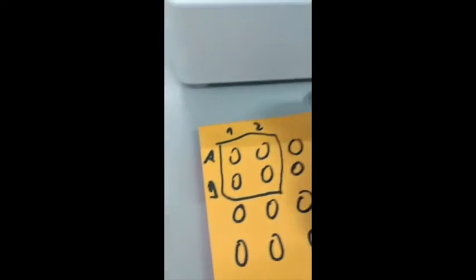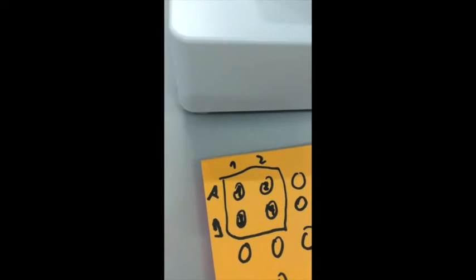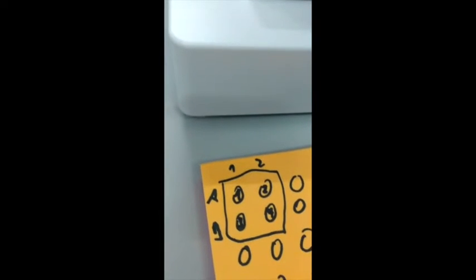So basically when that is your plate, that's what I meant with the quadrants. The first plate A1 will be here, from the second plate the A1 will be here, third plate, this A1 will be here. Fourth plate. When you have put that into an Excel sheet, then you can easily combine the 4 plates into one 384.